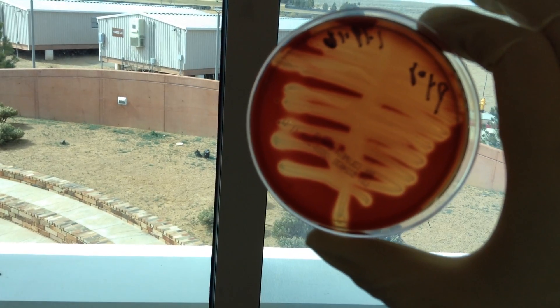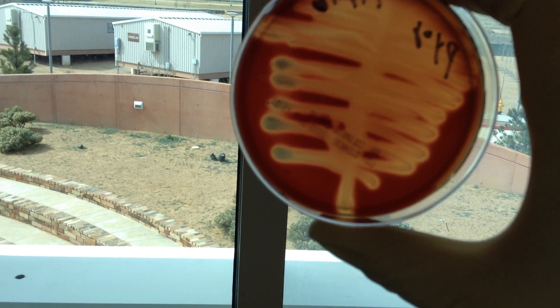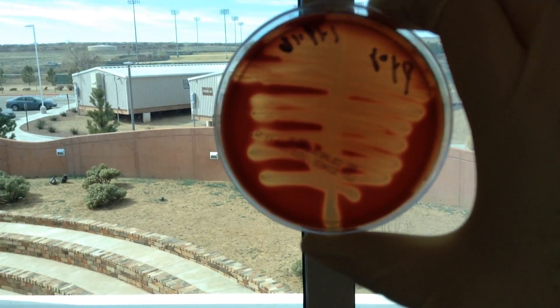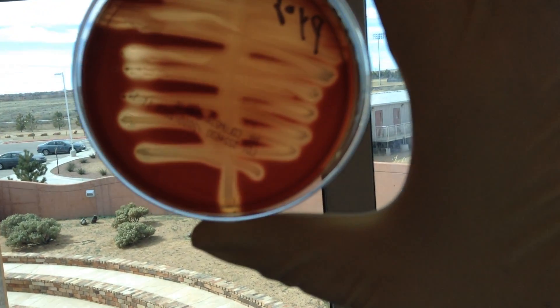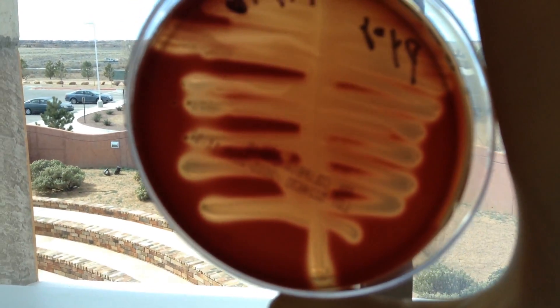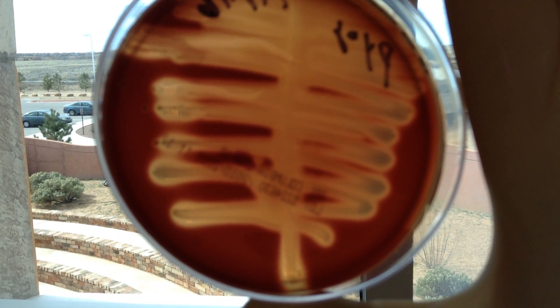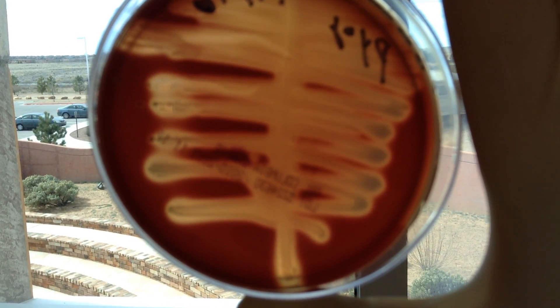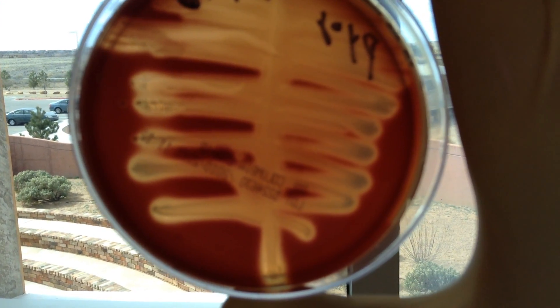You can see that the medium has been digested. If you look carefully, you can actually see the growth and where the hemolysins have been secreted into the medium and have broken down the blood. That's beta hemolysis.